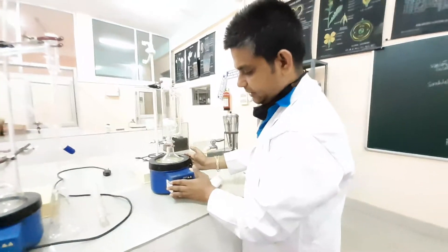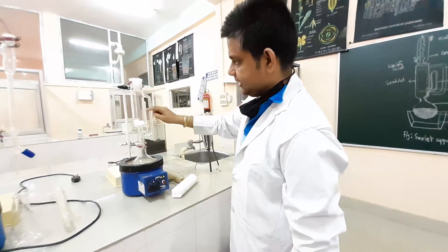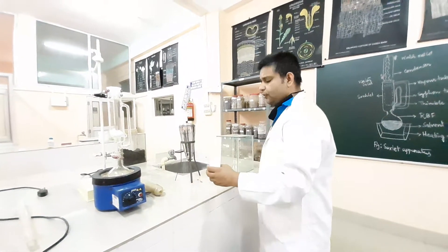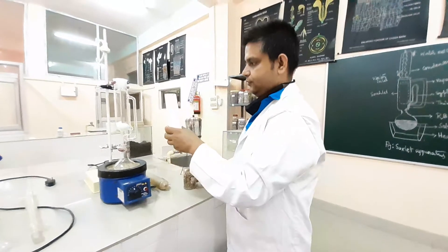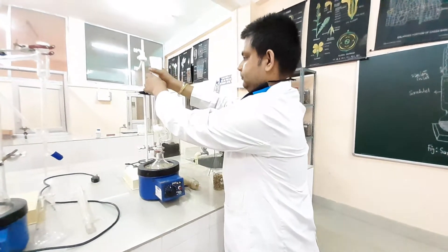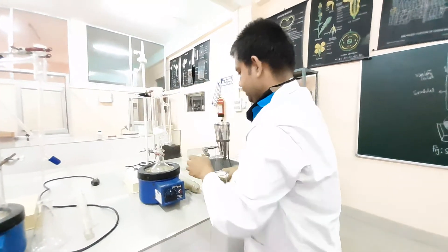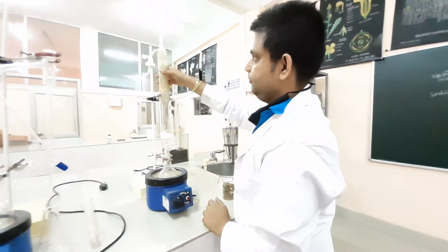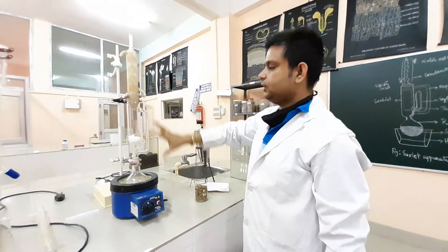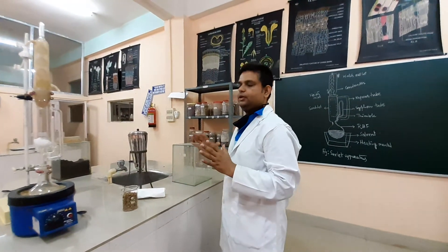Here we have the heating mantle, the round bottom flask, the Soxhlet chamber, the vapor tube, the siphoning tube, and the thimble made of filter material. The drug is packed into the thimble and slowly placed inside the Soxhlet chamber. The condenser lid is then closed, with a water inlet and water outlet for cooling. This completes the setup for the Soxhlet extraction method.